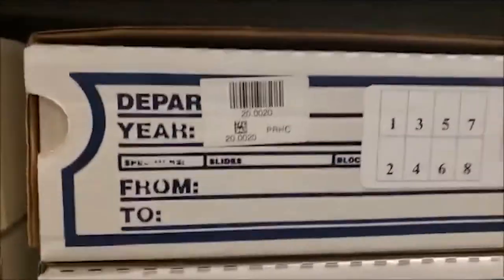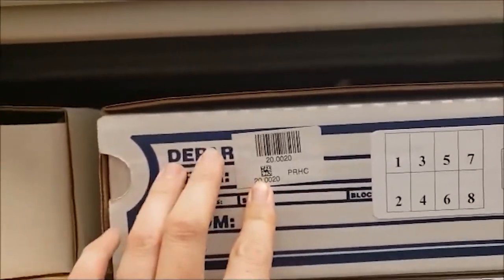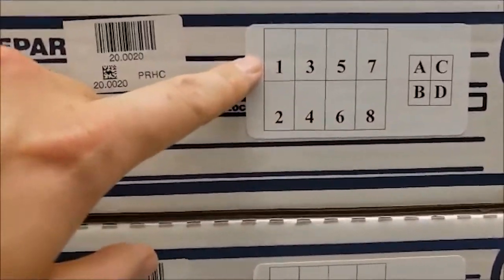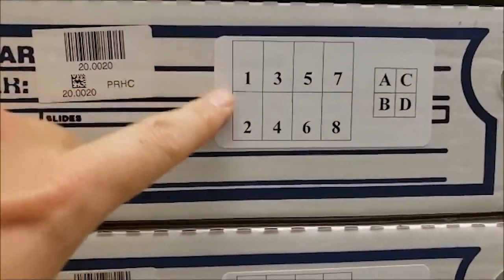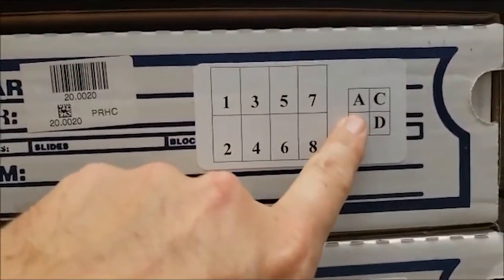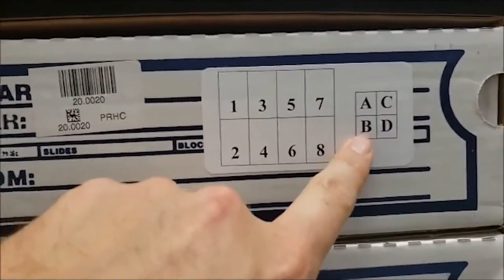Moving forward to SlideTrack, storage is a little bit different. Each box is now labeled with a year and a box number — 19, 18, 17, 16 — so they're just put in ascending order. Inside each box is a legend for magazines. There's a total of eight magazines, and inside each magazine is four sections: A, B, C, and D.